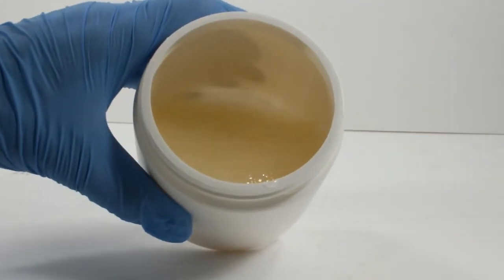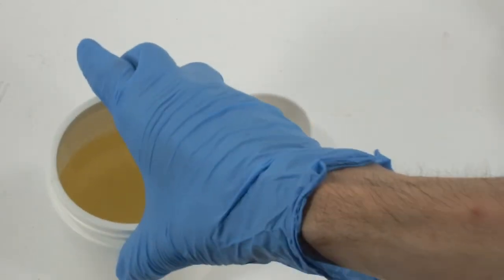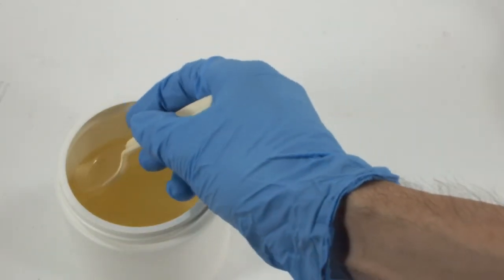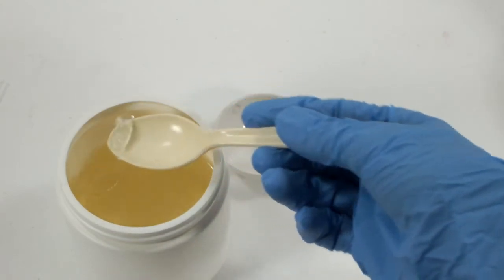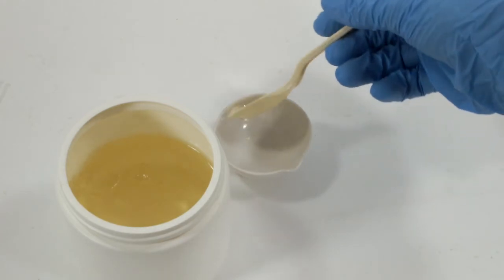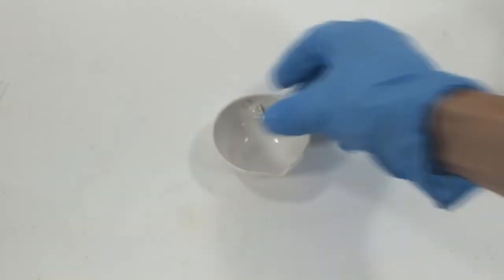So let's take this poor little evaporating dish with a stain of who knows what on it and give this stuff a test. It's been a couple of days, so now it is a pretty firm gel. I'll just plop a little dollop directly on the stain, rub it around a bit, and then rinse it away.